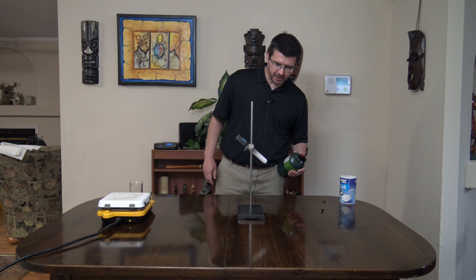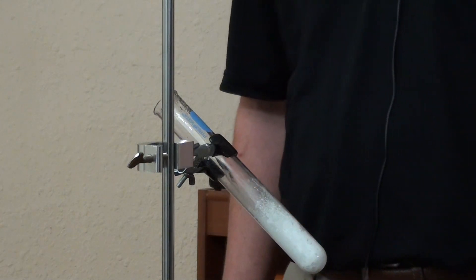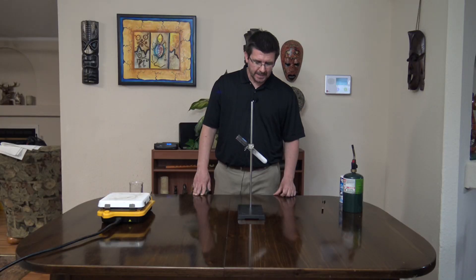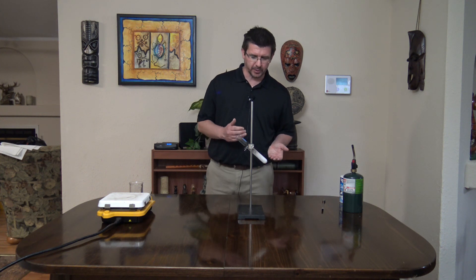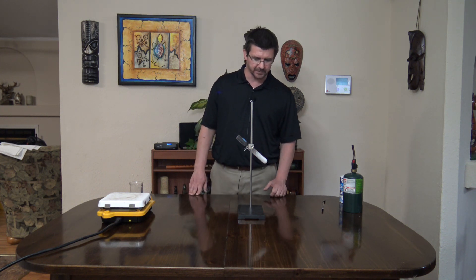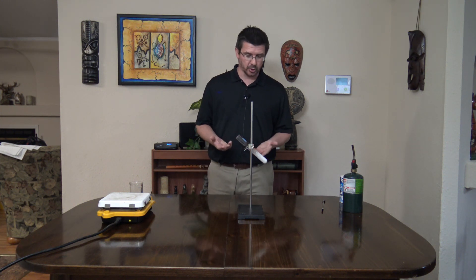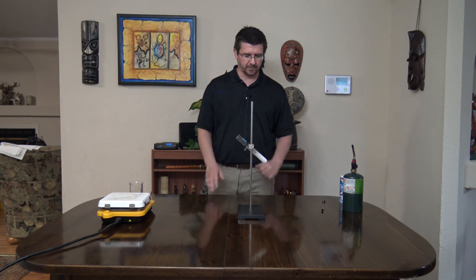All right. It looks like our water has evaporated out of the tube — you don't see the clear liquid anymore. But now you see white powder in the bottom, which is the salt that we'd dissolved in the water earlier. Basically what's happened, it's left behind in the tube because the water had such a lower boiling point. We were able to separate the two not by a chemical reaction, but simply by boiling the water — changing its state from a liquid to a gas — and leaving the solid salt behind. You'll also notice that the particles of salt are much smaller than they were before, because that process of dissolving with a soluble material breaks it down into smaller pieces. What's left behind is still salt, just smaller pieces than we put in.